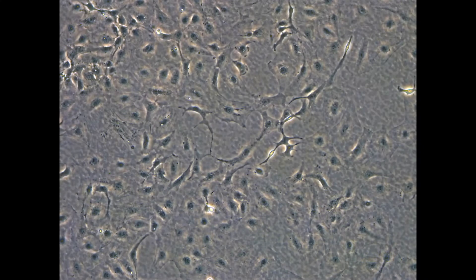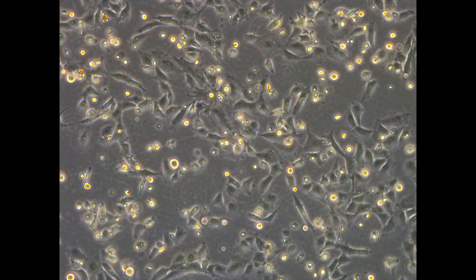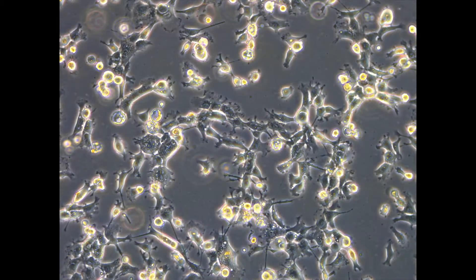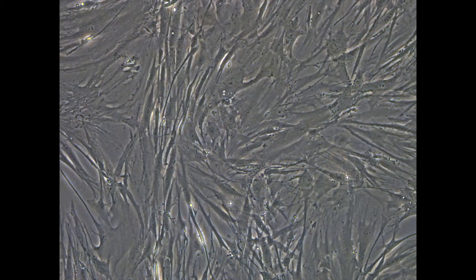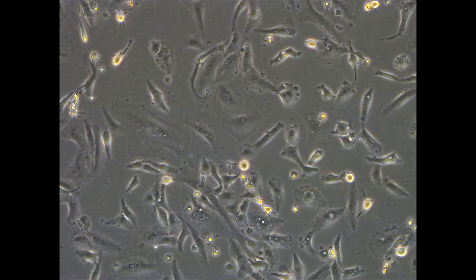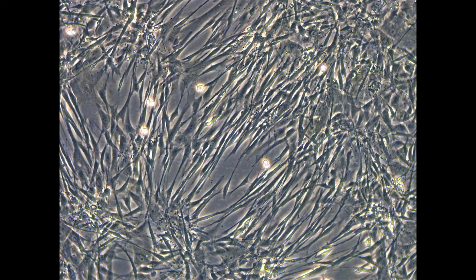Cell culture is the process by which human-derived cells are grown in the lab under controlled conditions outside of their natural environment. At ADRI, a range of asbestos-related cancer cell lines are routinely cultured. These cell lines serve as a useful tool for downstream laboratory applications aimed to elucidate the cellular mechanisms that mediate asbestos-related disease.